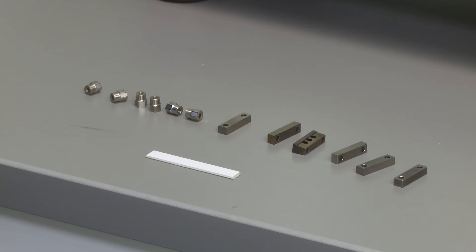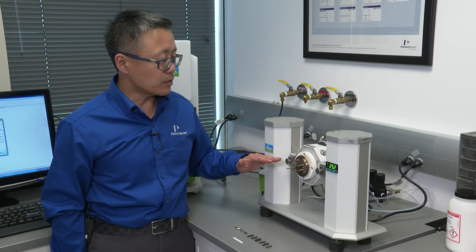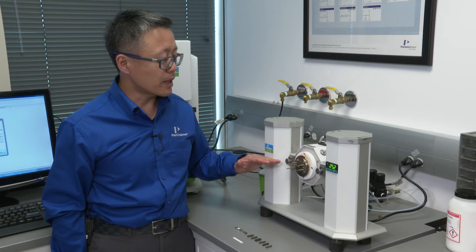These are the parts for dual-cantilever bending tasks. We are doing this with a horizontal position to minimize the gravity factor.